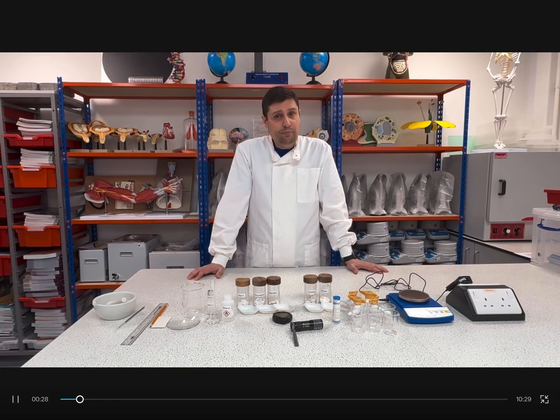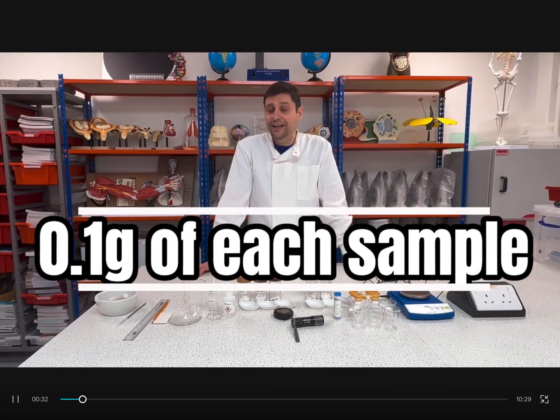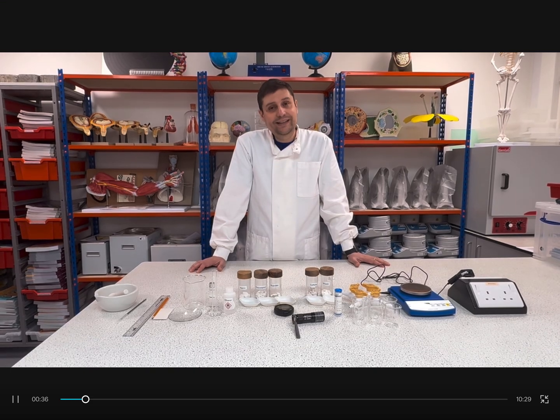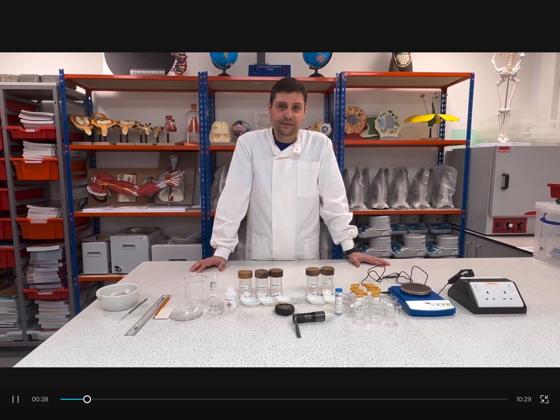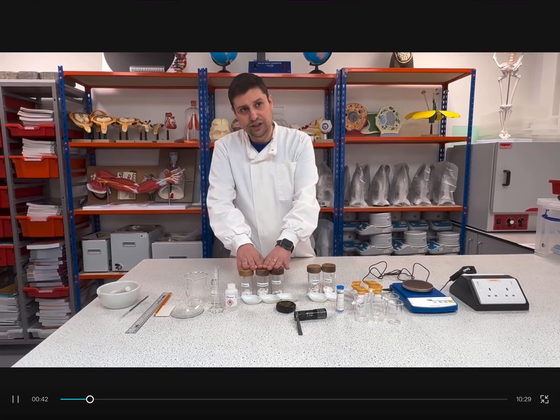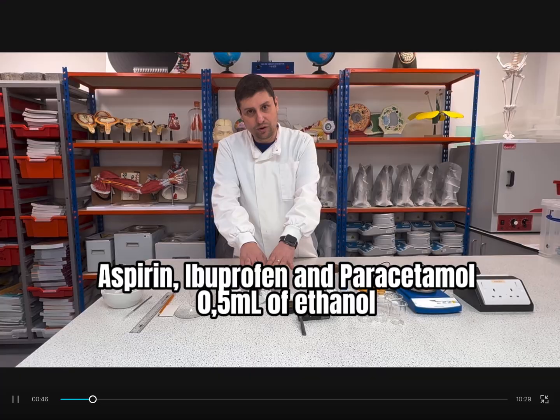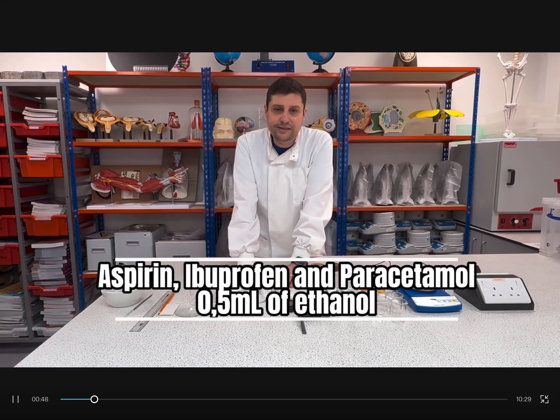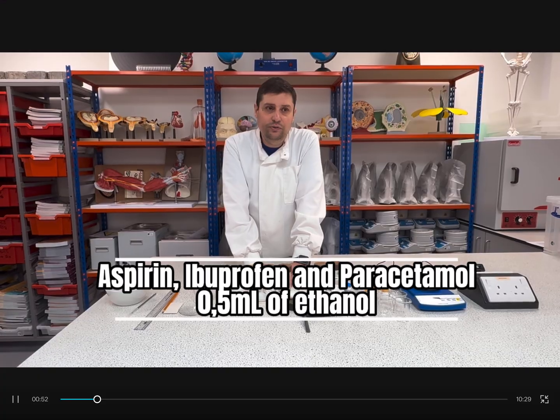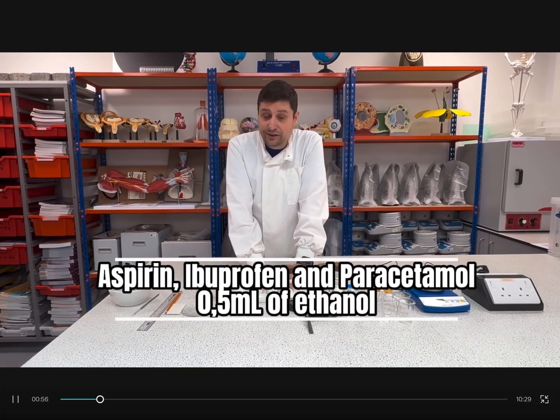After grinding the sample, we will collect 0.1 grams of each sample and we will dilute in different volumes of ethanol depending on the sample. These three samples here, that's aspirin, ibuprofen and paracetamol, we will collect 0.1 grams of the solid and will dissolve in 0.5 ml of ethanol.